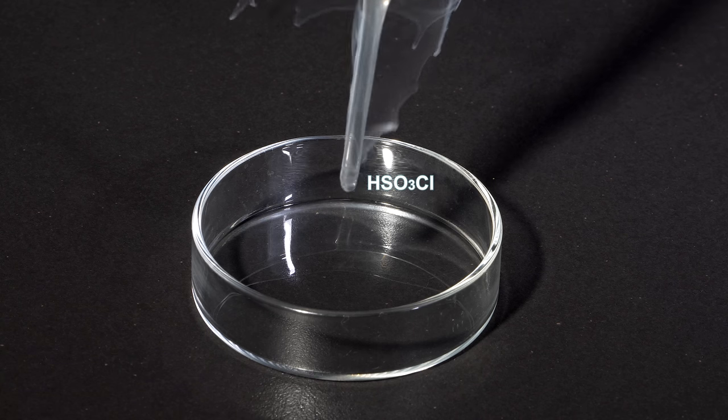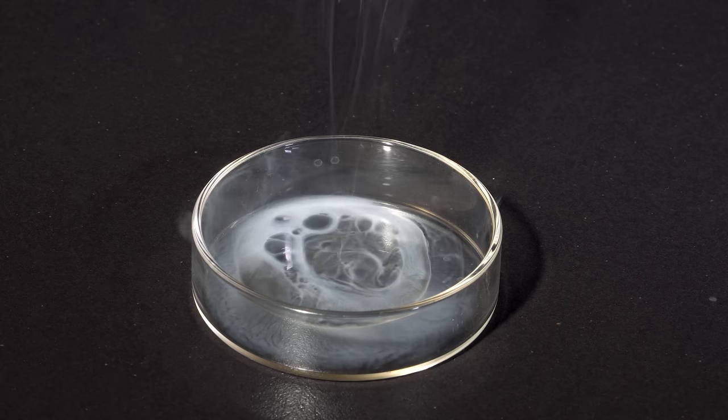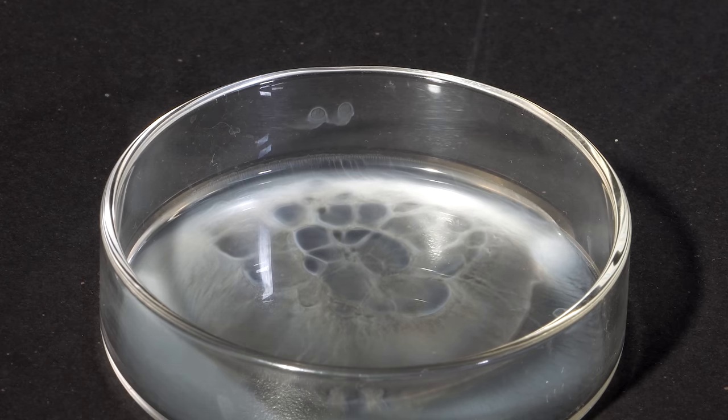Interacting with water, chlorosulfonic acid is hydrolyzed instantly and very violently, which results in the formation of sulfuric acid and hydrogen chloride.